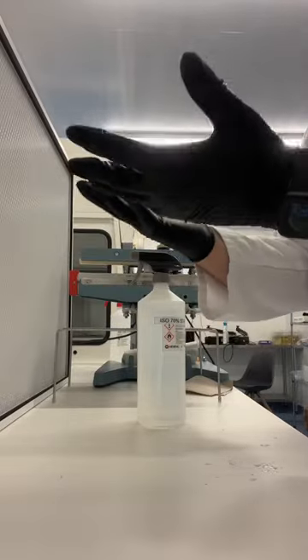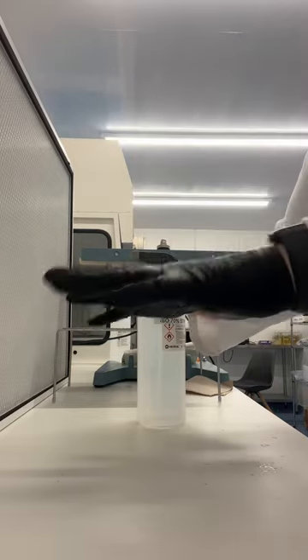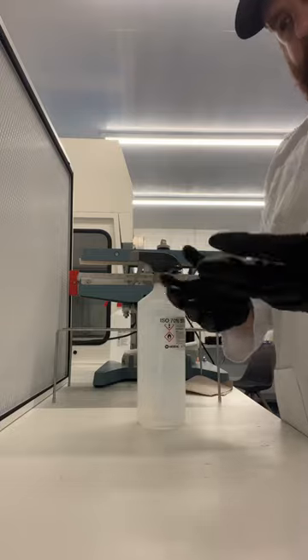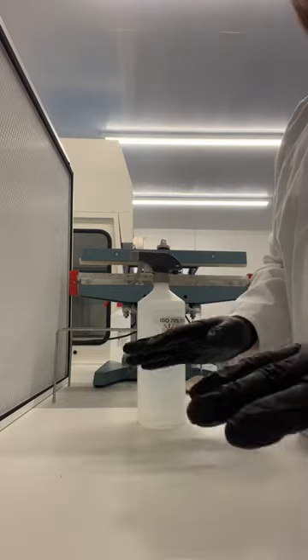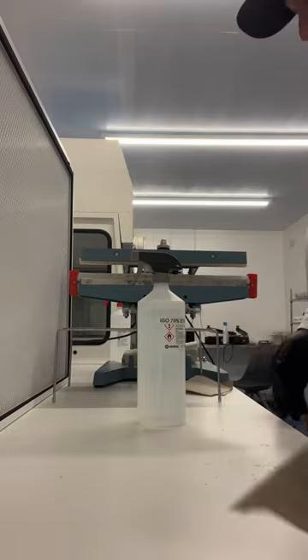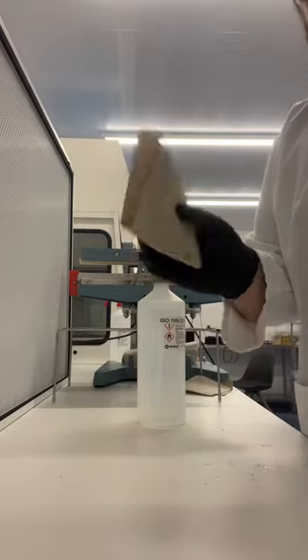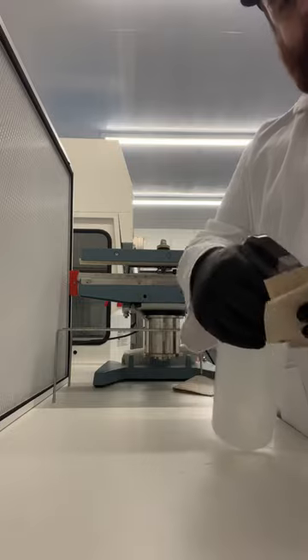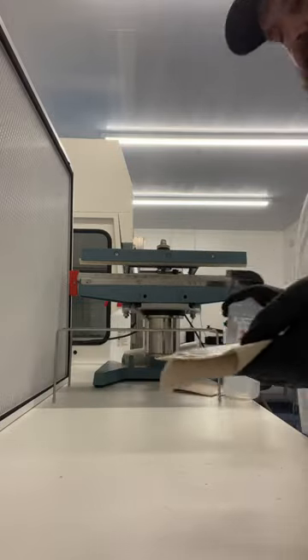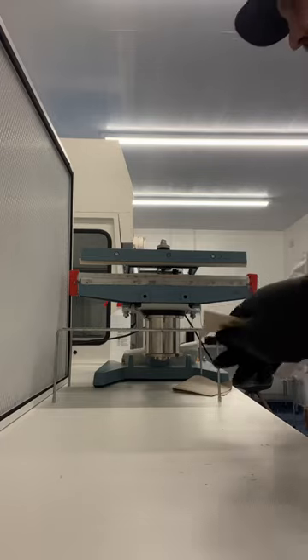I'll allow my hands to dry in the flow — I want everything to have evaporated off my hands, and it's the same with all the surfaces. We don't want wet isopropyl on things that hasn't done its job. I keep a stack of folded paper towels in little squares like this, and again, away from the filter, I'll saturate the paper towel.